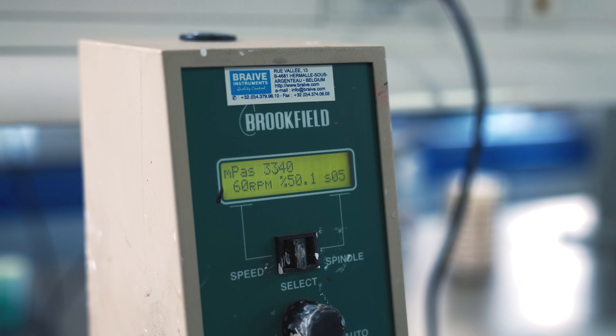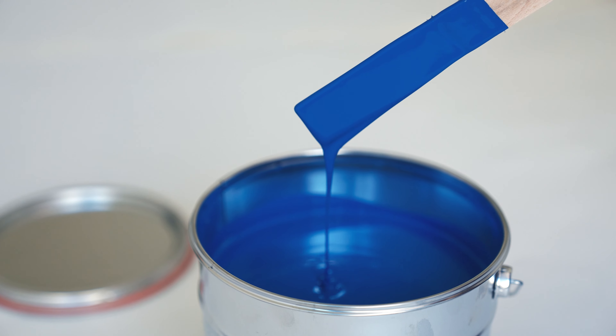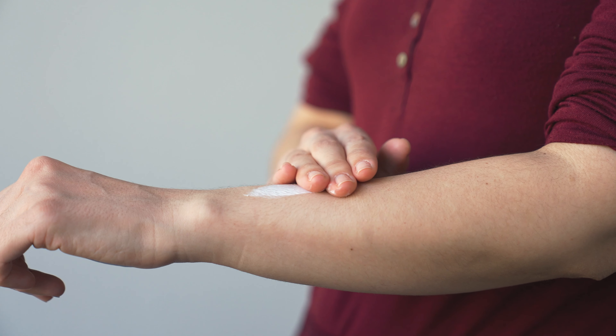If you are manufacturing a viscous liquid, it's important to you and your customer that the viscosity profile is just right. A paint must be thick in the can, but thin when it's brushed on the wall. A lotion must be thick in the bottle, but almost like water when it's applied to the skin.